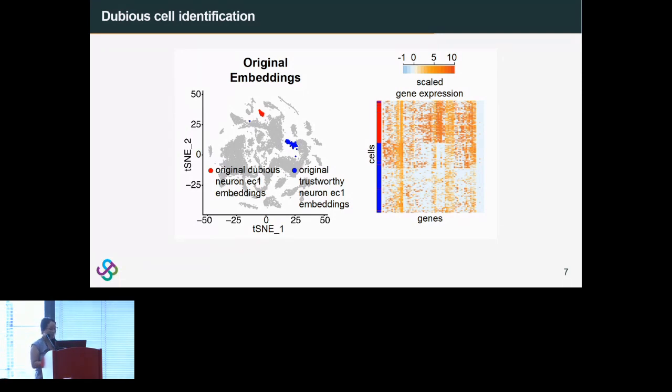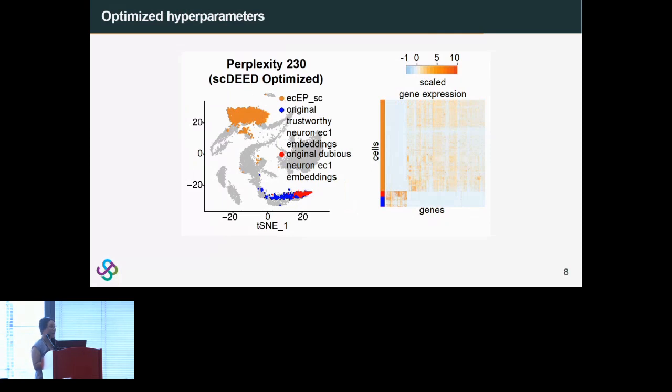If we look at the optimized perplexity of 230, we actually find that the neuron EC1 embeddings have been unified, which further supports that the previous split into two clusters is not real, but just an artifact of the dimension reduction. We can also compare with the orange stem cell cluster, which has totally different gene expression than the neuron EC1 cluster. This is reflected in the 2D visualization in which they're really far apart. This is what we would more expect, that distance in the 2D visualization should represent more different gene expression. So already this optimized perplexity is providing a more intuitive visualization than the original parameters.